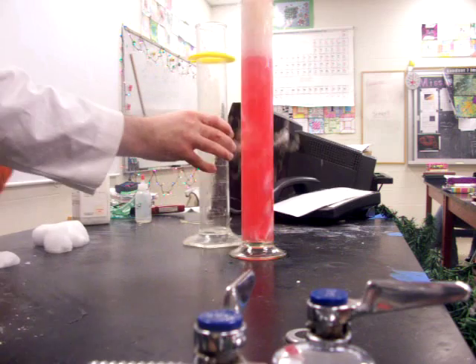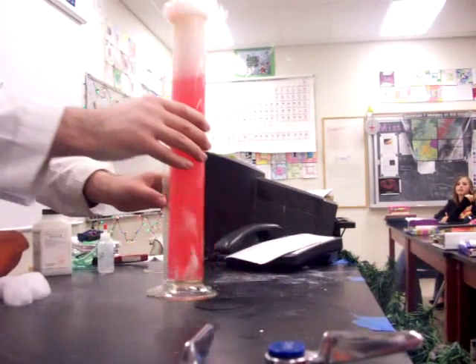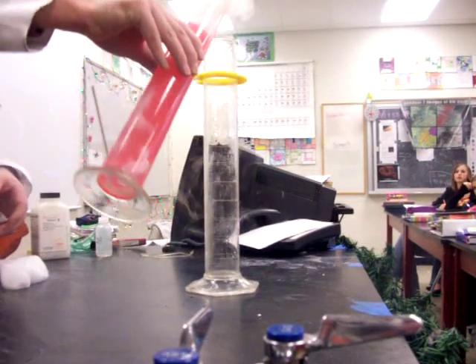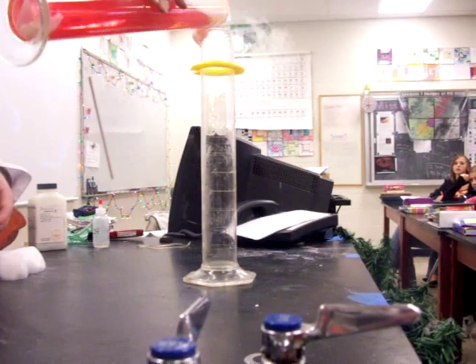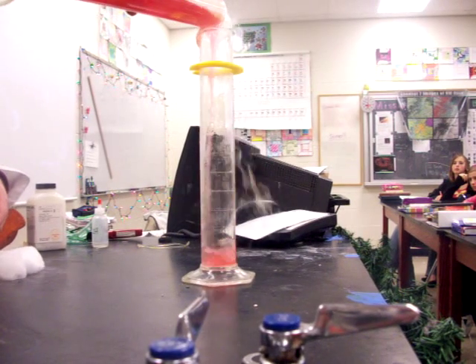so what I'm going to do is transfer it to another graduated cylinder, and then we'll try to send it back into the neutral and even basic range.